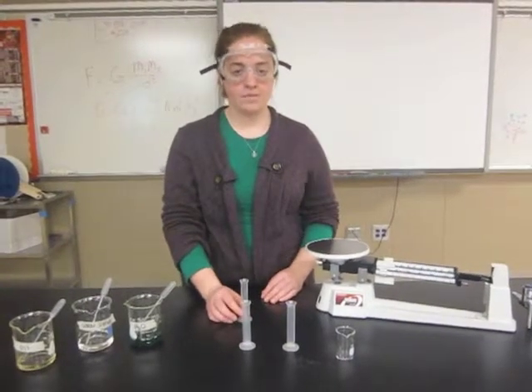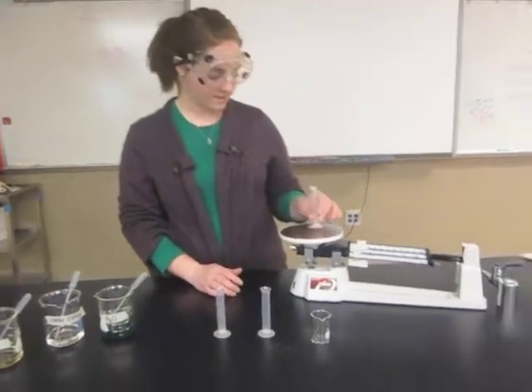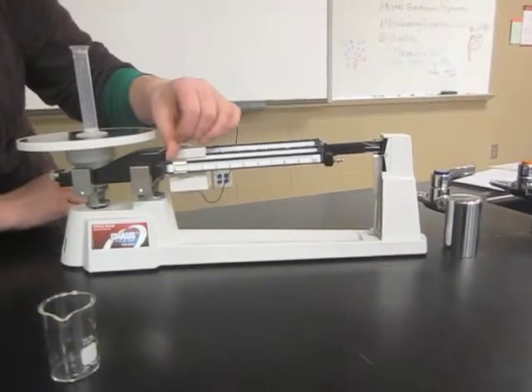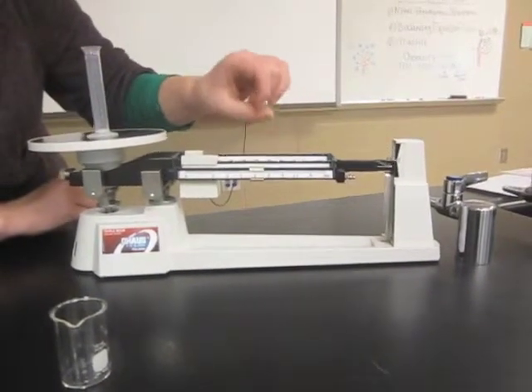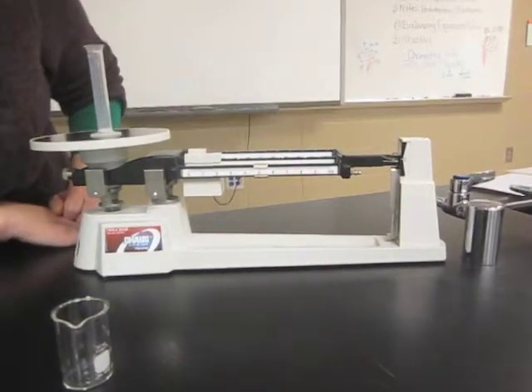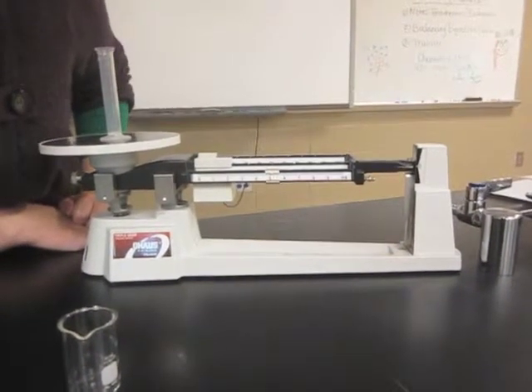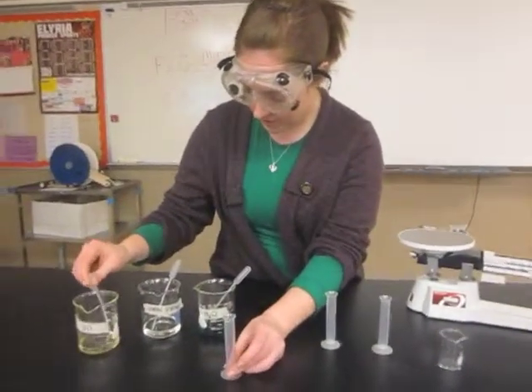In order to find the mass, we need to find the weight of your graduated cylinder. The first thing you want to do is find the weight of the empty graduated cylinder by placing it on your triple beam balance. Remember, you want to be as close as possible and line them up. The weight of my graduated cylinder is approximately 5.1 grams.